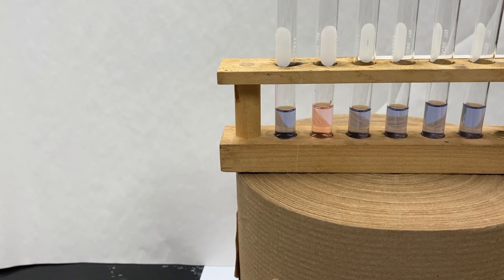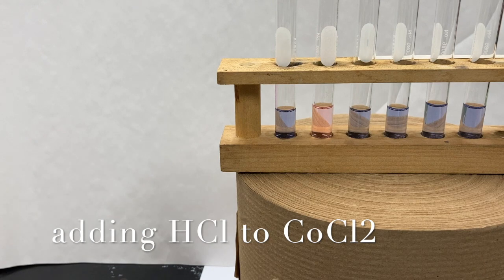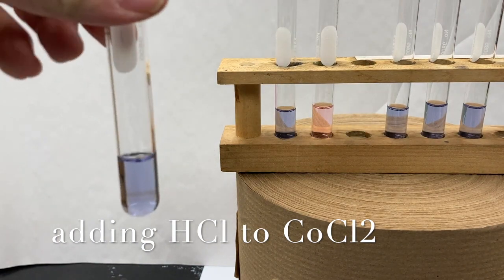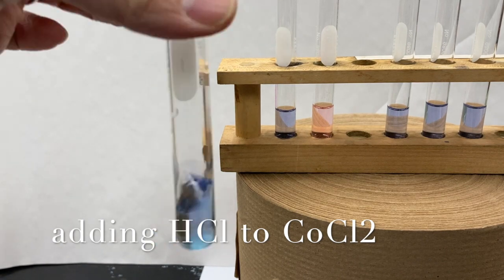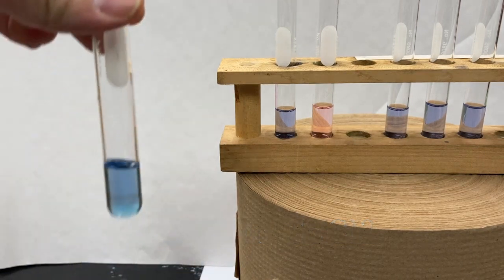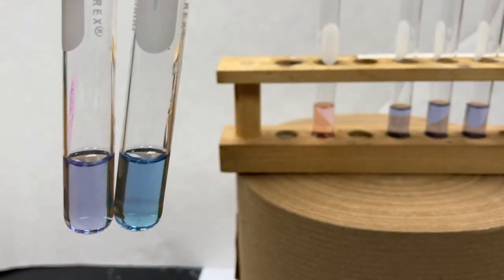Okay, so to tube 3, we are going to add hydrochloric acid. So we've got some hydrochloric acid right here. So tube 3. Notice the change in tone.